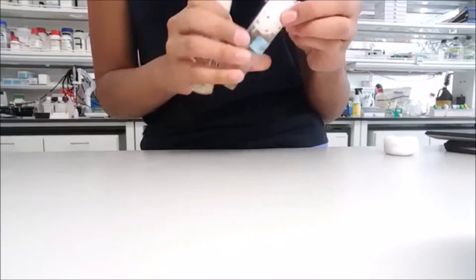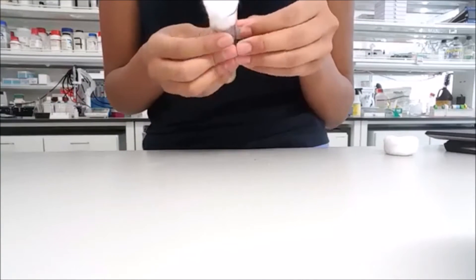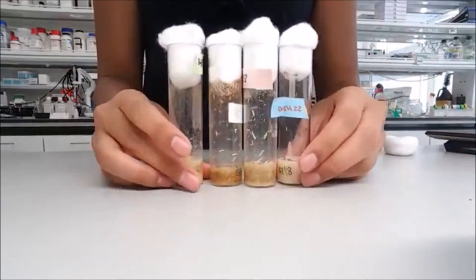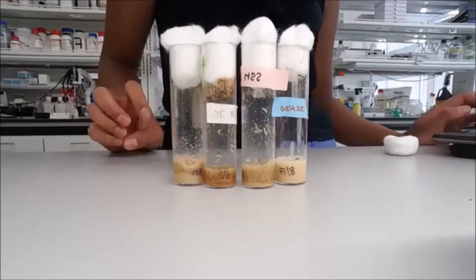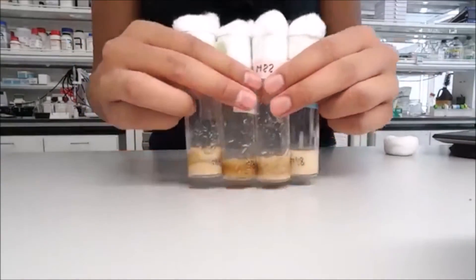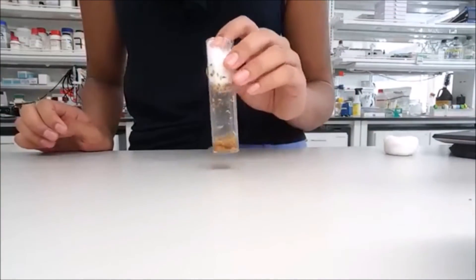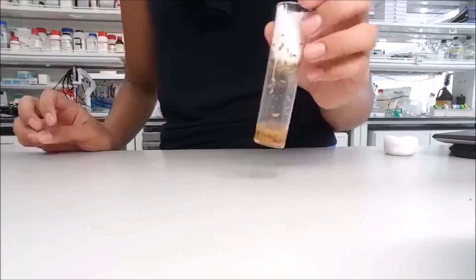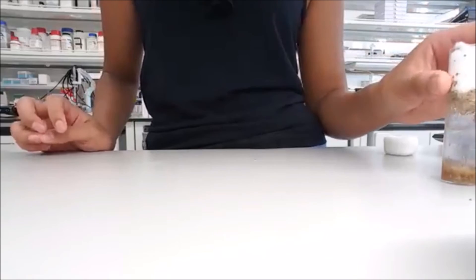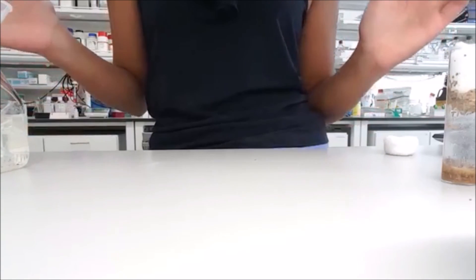After that, we're going to transfer the tag so we know which line this is. And there we have it — our line is now up to date and maintained. We'll put it back where it came from, put the old vial into the freezer so any leftover flies won't be flying around the lab, and the morgue gets dumped into the sink. And that's stock maintenance.